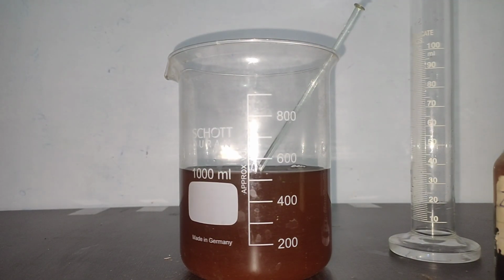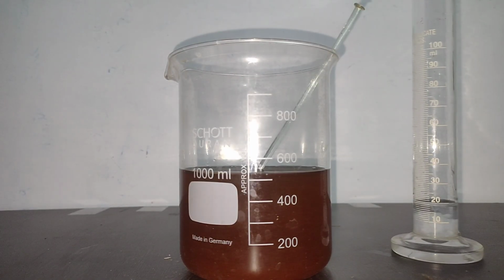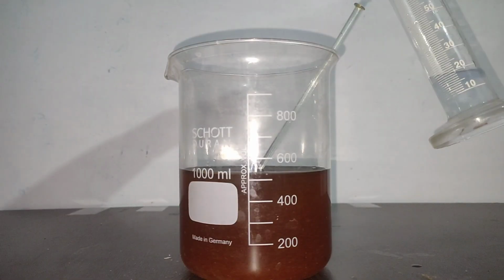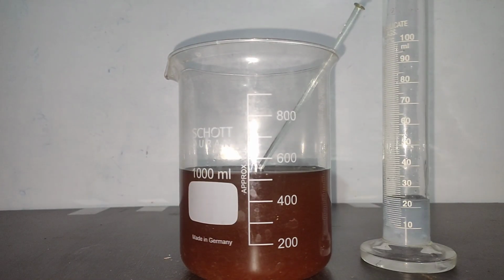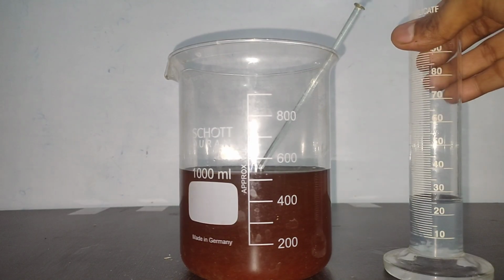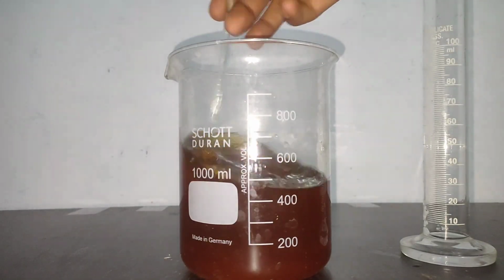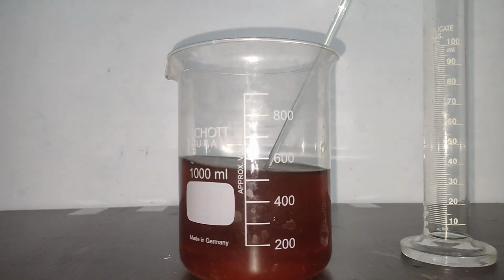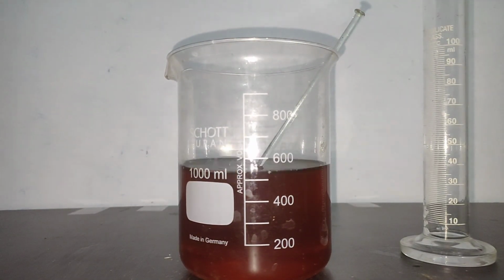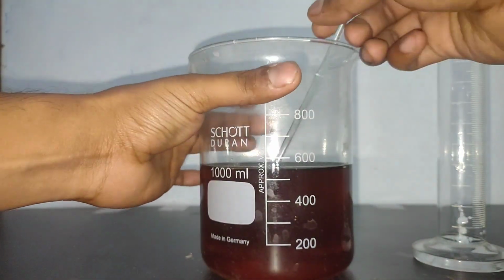On adding zinc chloride, zinc ammonium phosphate should be precipitated out. But what happens here is some zinc hydroxide is also being precipitated, and when I added some additional ammonia, the zinc ammonium phosphate also gets dissolved. So this precipitation is not very reliable for phosphate, as the precipitate is soluble at high pH due to the complexation of zinc ions with ammonia, and also due to the precipitation of zinc hydroxide at a lower pH. This method cannot be used to quantitatively measure the amount of phosphate.